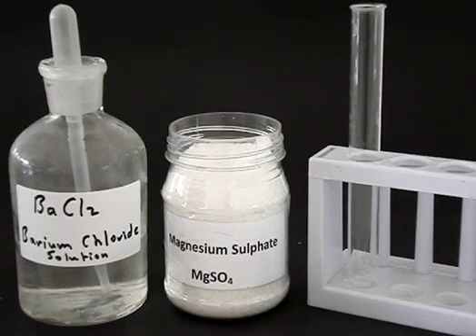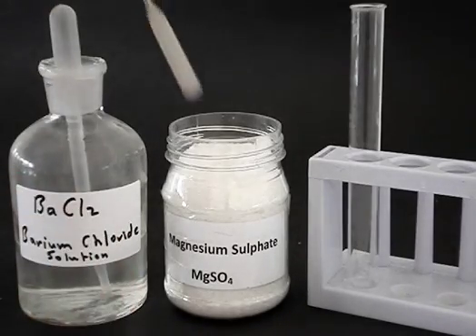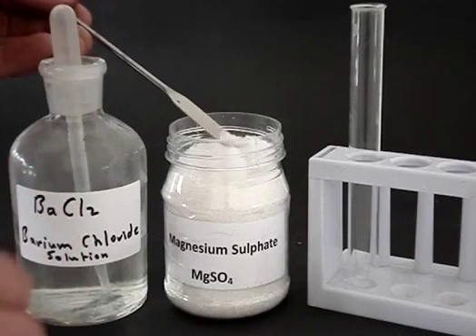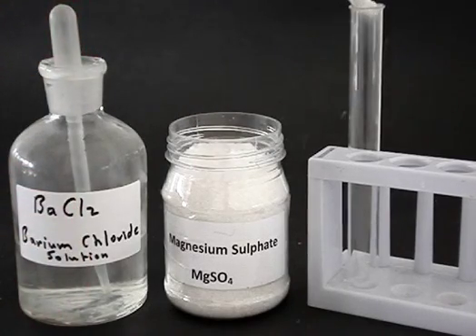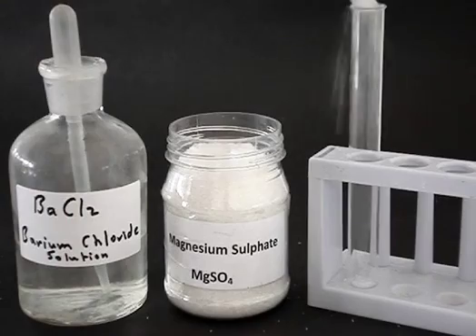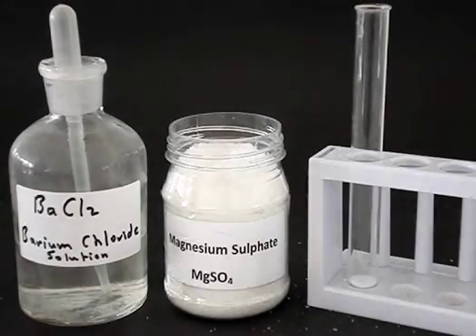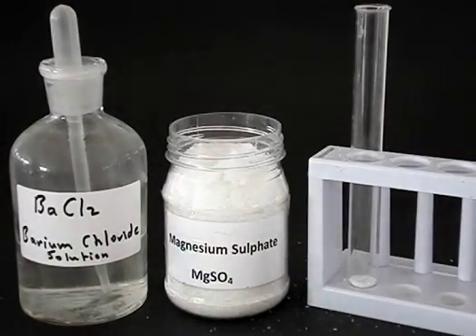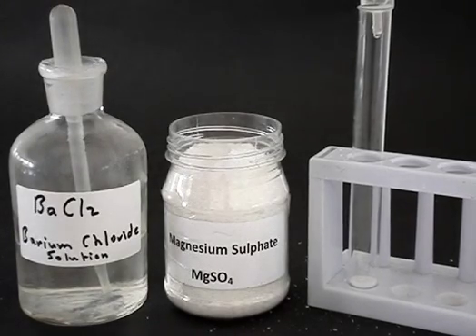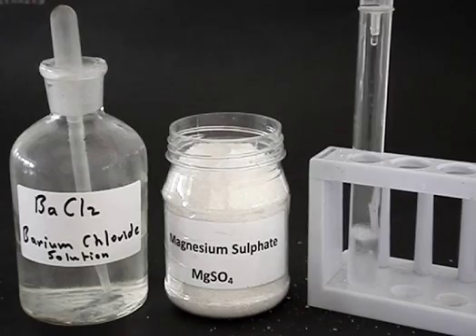Now if we take some magnesium sulfate crystal — some white powder — and we place it in a test tube, what we're seeing there is magnesium sulfate in the solid phase. And then if we add some water to that, we can make a solution; we can change the magnesium sulfate into the aqueous phase.